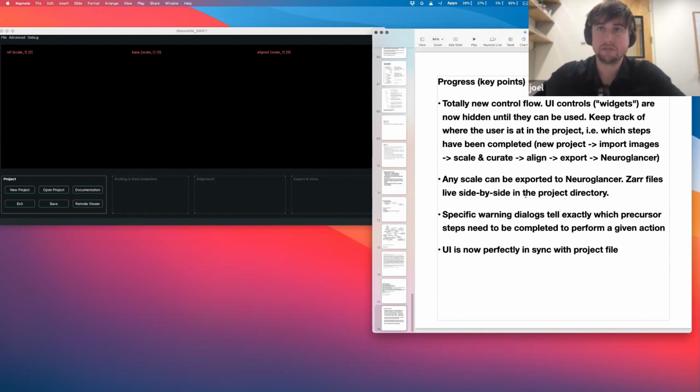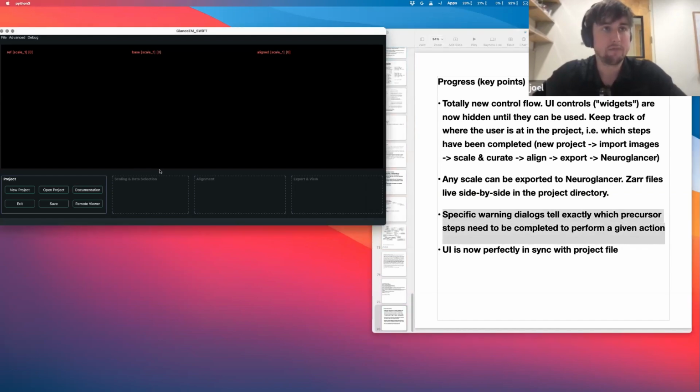So then another thing that helps is the warning dialogues. So let's try to generate one of those right now. Oh, and an interesting thing. Since I came up with this new control flow, I found that it now makes it impossible to even get a lot of the warning dialogues that I spent a lot of time making. I had all these warning dialogues for if you try to do something that's not supported or doesn't make sense, then the warnings will very clearly say why you can't do that and what you have to do before you can use that feature. But a lot of those were nullified because of the way I've got this now.